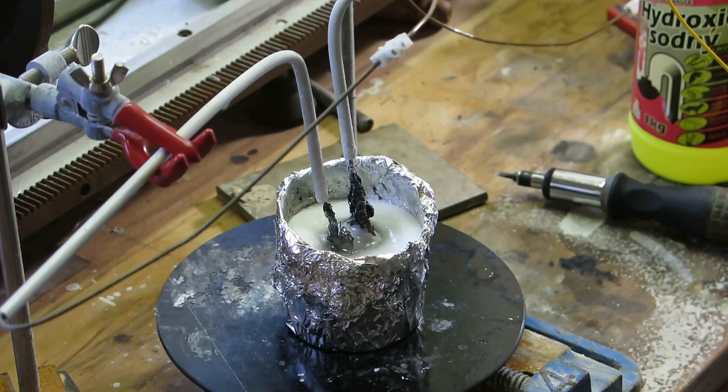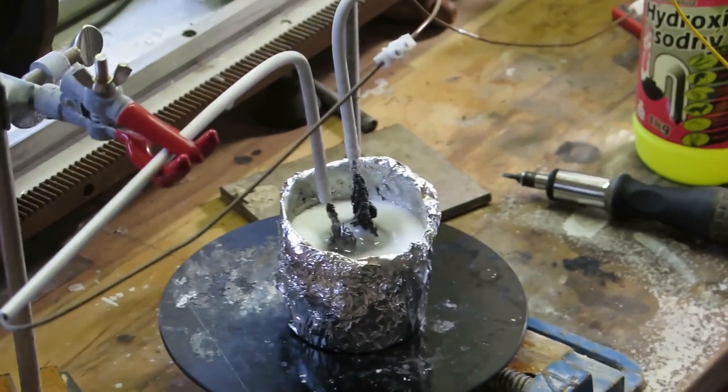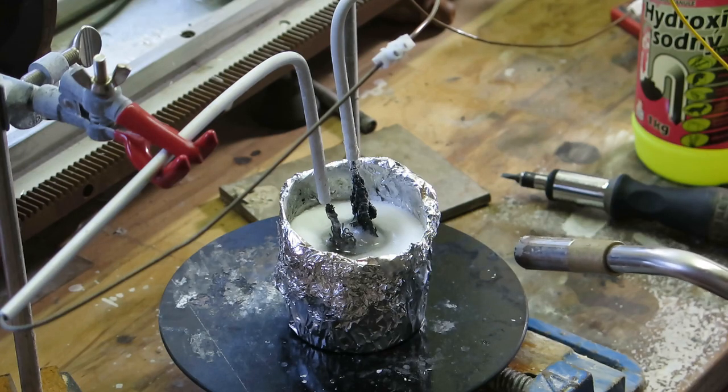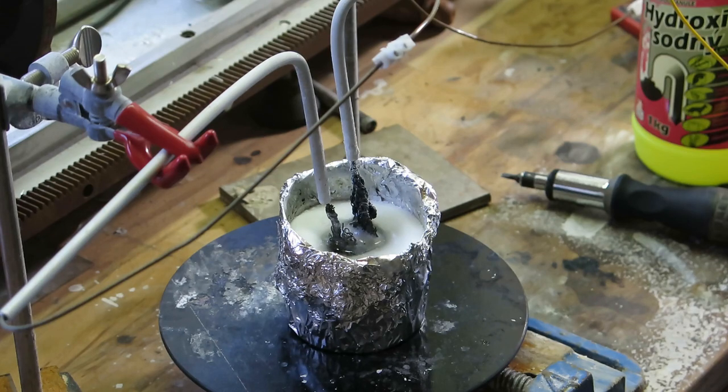You must never let this completely freeze, because the hydrogen and the oxygen, when it explodes inside some molten material, this can eject a lot of it at you, basically, so don't do that.